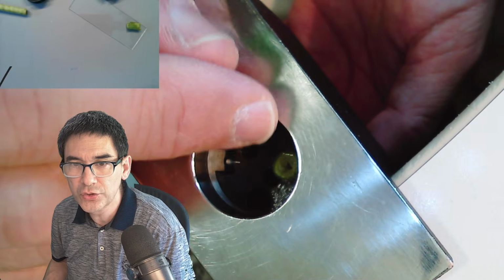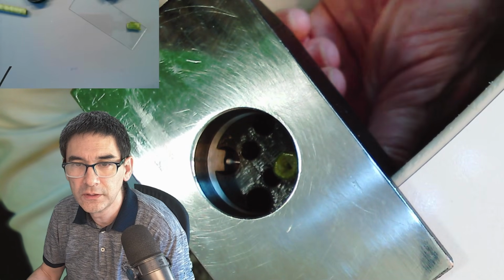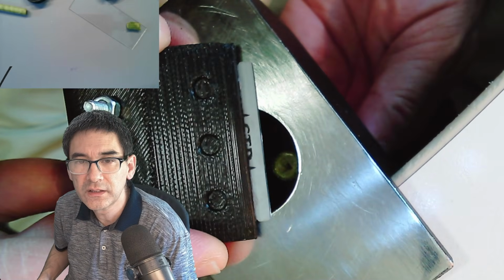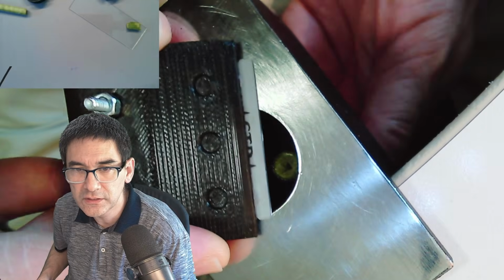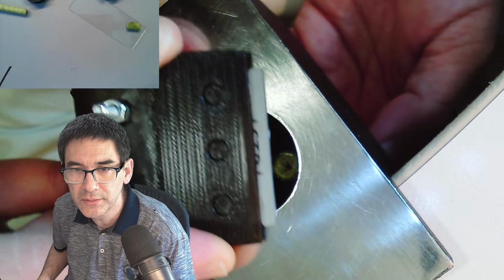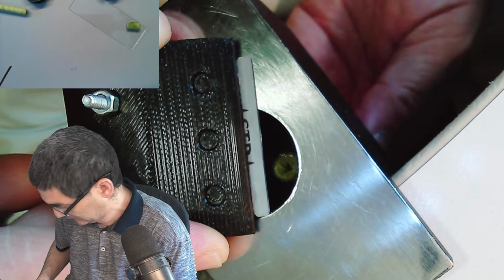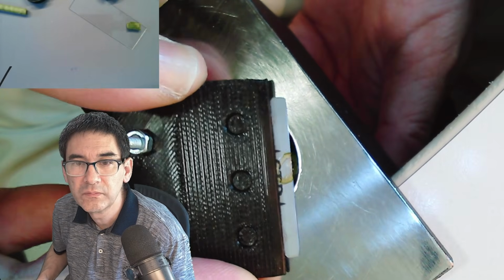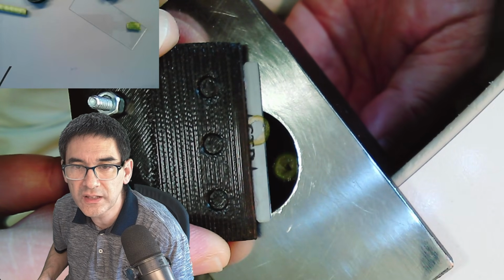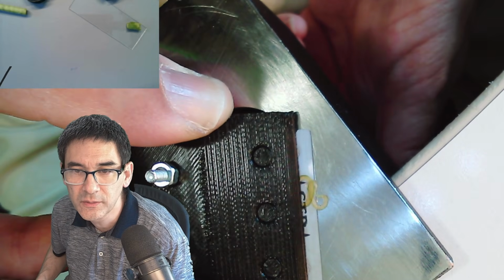Unfortunately it's a little bit dark here from the exposure, but now I'm going to rotate the knob. And I'm going to try to slice off until I'm able to slice off. See, it's still too deep. Here we go. Okay, that's the first nice one. And now I'm going to turn it 1, 2, 3, 4, 5, 6. Here we go. Do you see that?